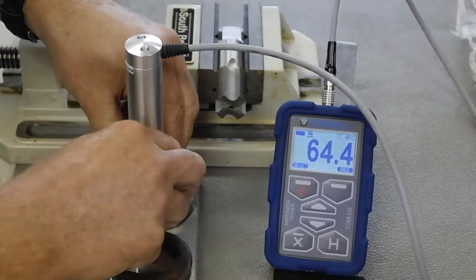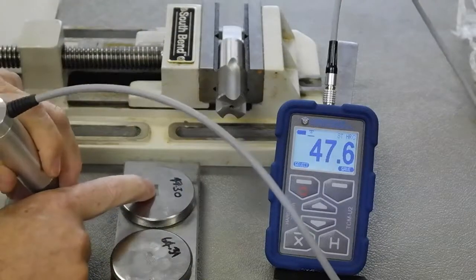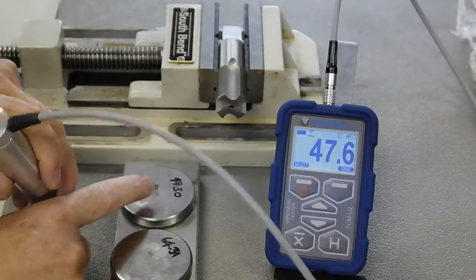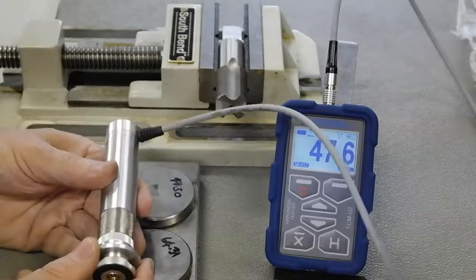Here we're going to do a test. 47.6 and the test block is 47.3. And I could keep on doing more tests of course.